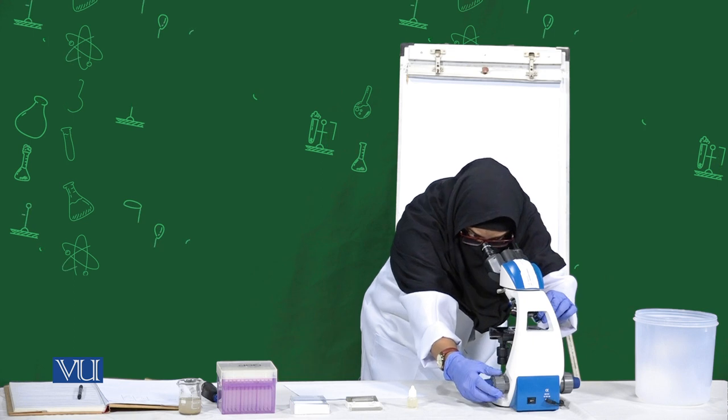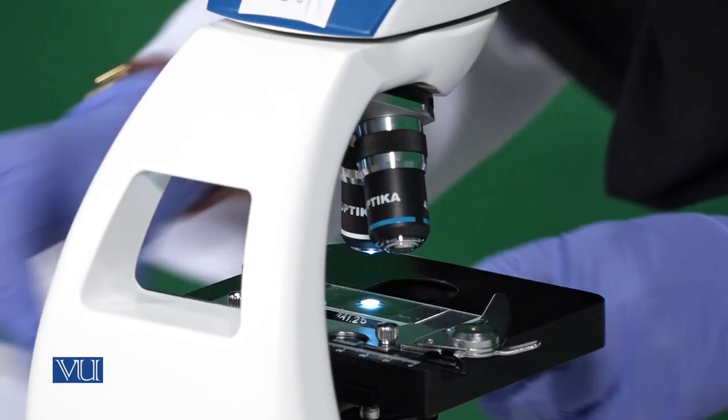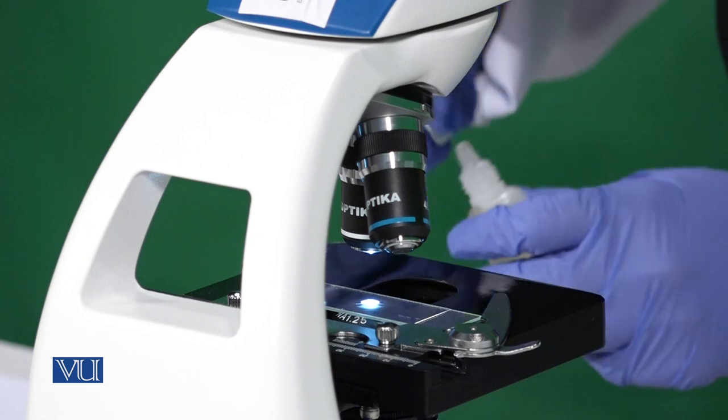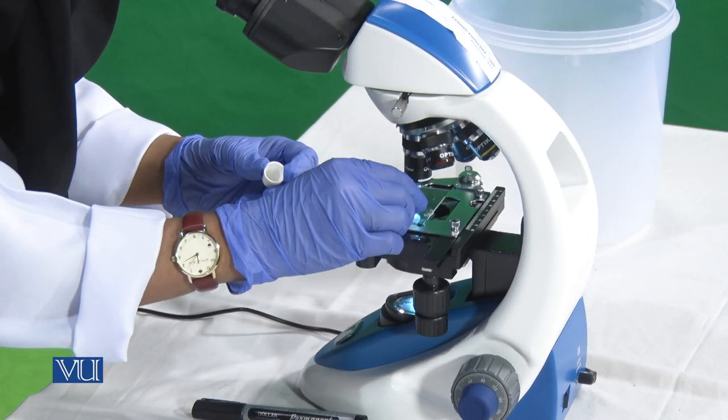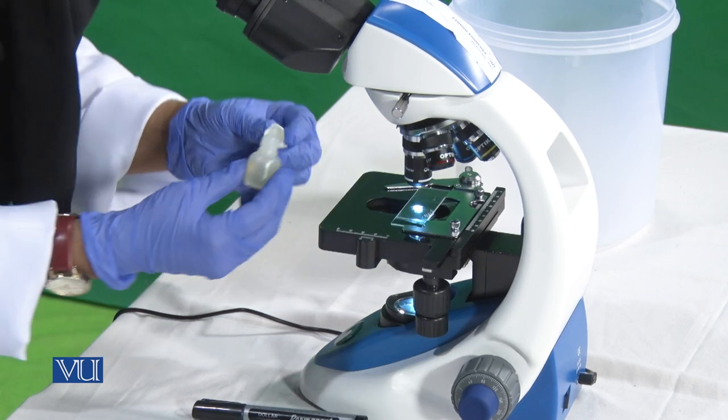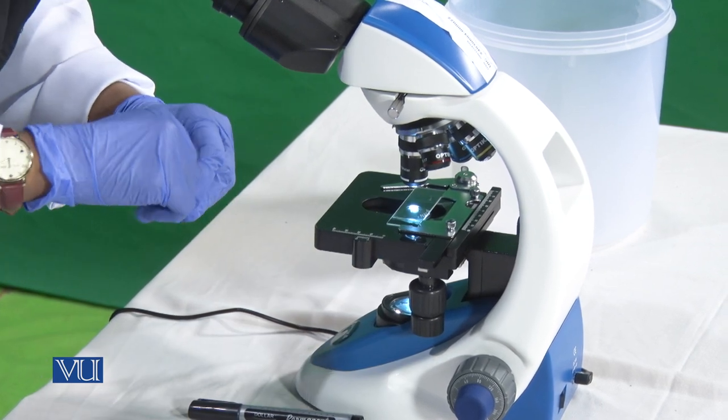Then under the observation of 100x, first I have to apply the oil immersion. One drop of oil immersion is enough for visualization.